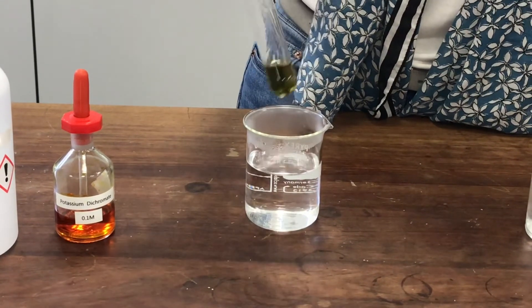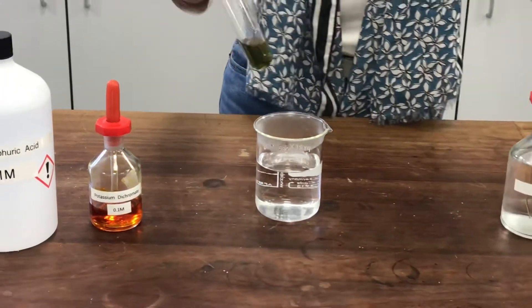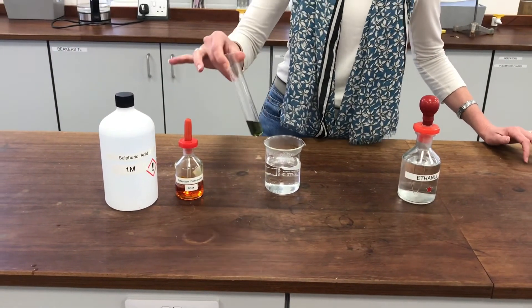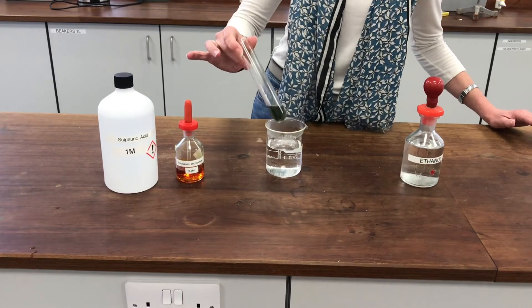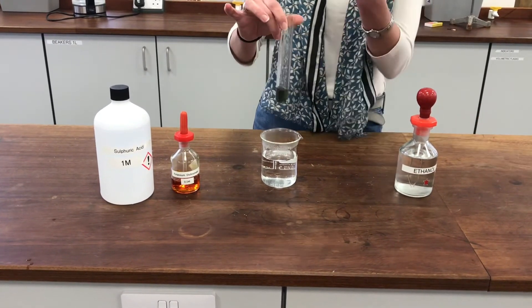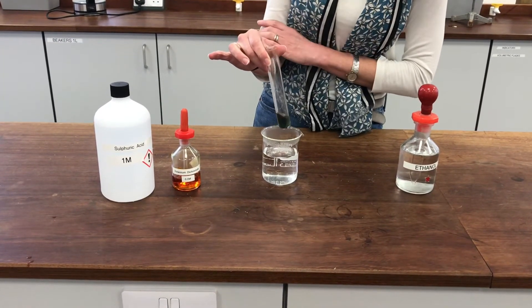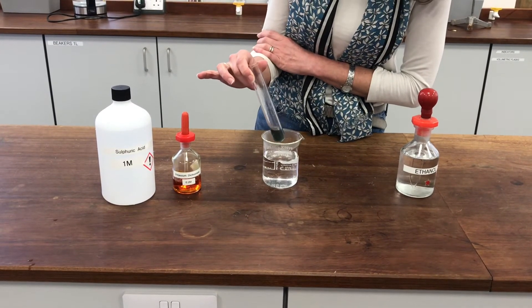I can see that really lovely green colour, which tells me that the ethanol has been oxidised and my potassium dichromate has been reduced, so it's a redox reaction. And if I were to smell across the top of that I would be able to smell something very familiar — it would smell like ethanoic acid, which you know more commonly as vinegar.